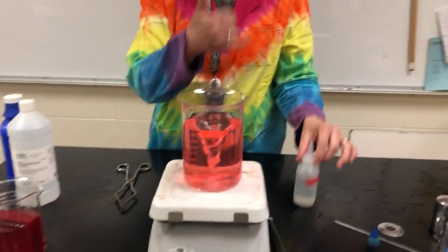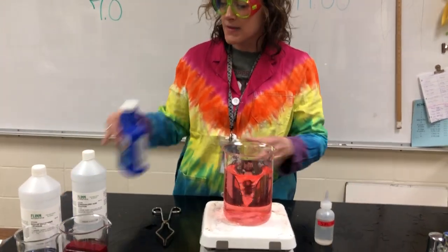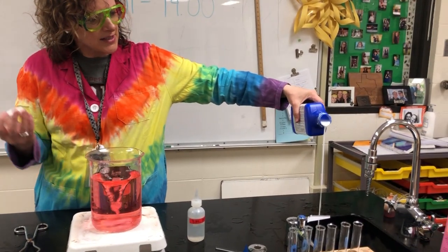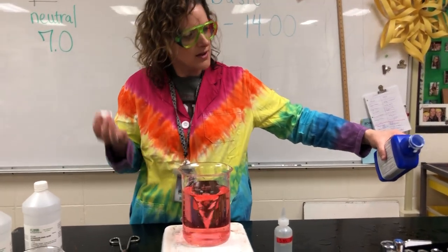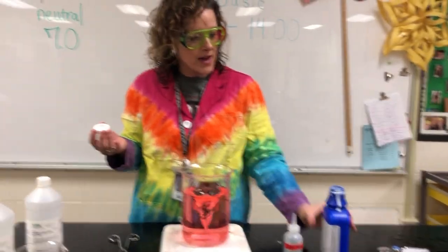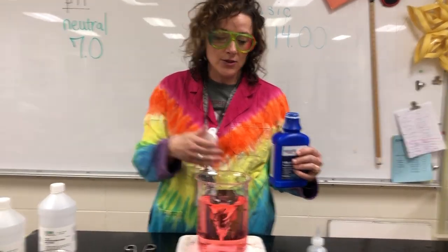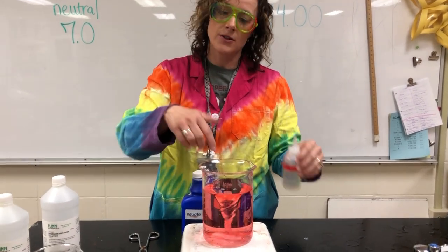So hydrochloric acid is an aqueous solution. It's very soluble in water, but milk of magnesia is really a coarse suspension. And we can tell that. Whenever I look at this, when I pour this stuff out, it doesn't look like it's dissolved in anything. It's going to be very opaque. Solution should be clear, like how hydrochloric is. So it started off as just a suspension, and then as the magnesium hydroxide got more and more reacted and neutralized, we end up with a solution because now we have excess hydrochloric acid in here.